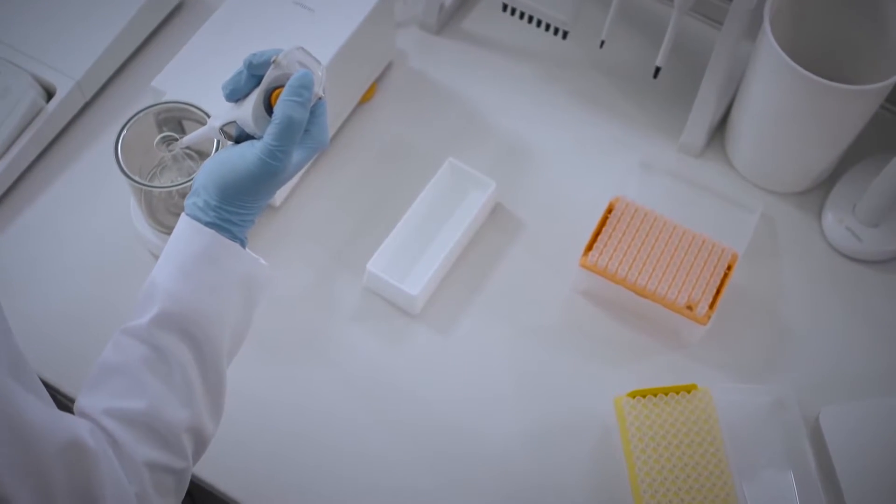When calibrating pipettes, it's important to keep an even rhythm in your work to maintain consistent timing.